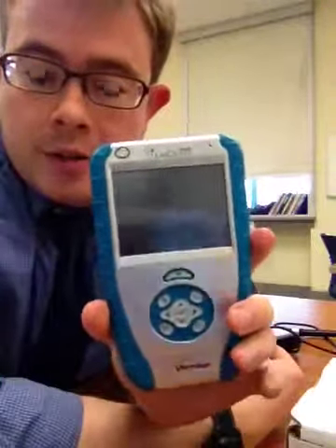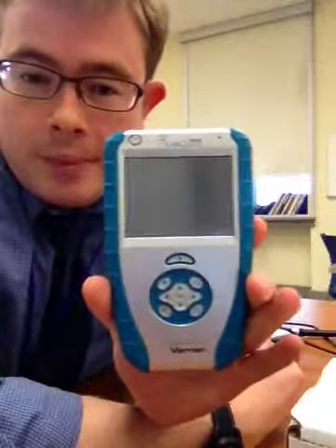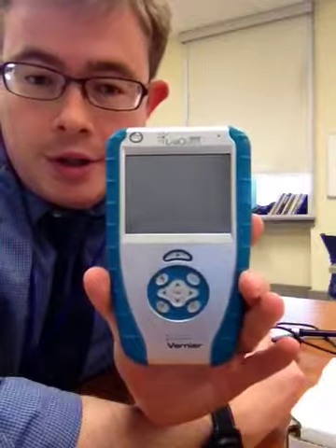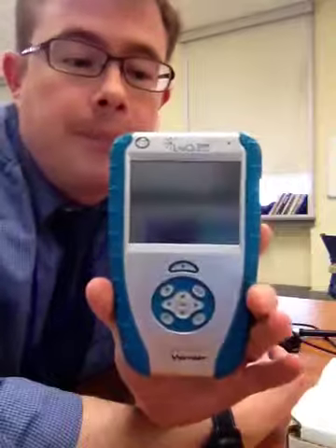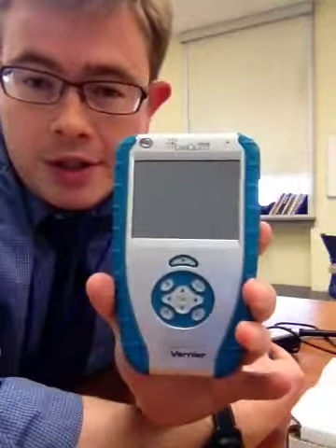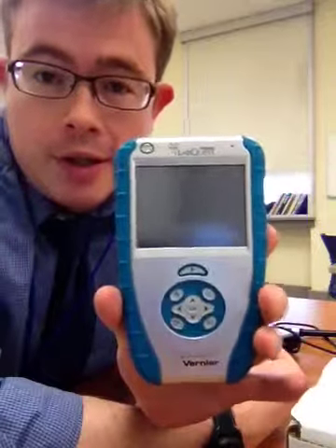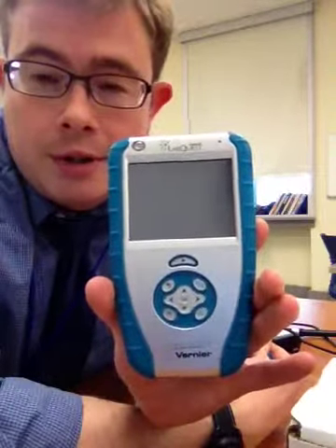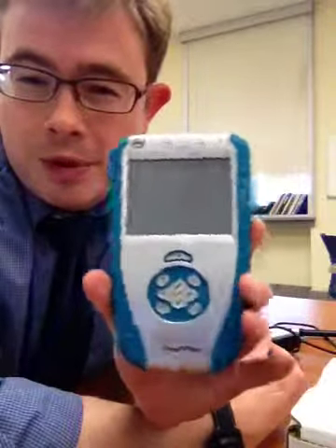Okay guys, we're going to take a minute or two and just look at how the LabQuest works in general, and then you can work on the individual probes. This is a really useful tool because everything is housed right here. There's no need to even have a computer in any way, so it saves you a lot of time trying to set up Logger Pro. You know, it just is a better tool.